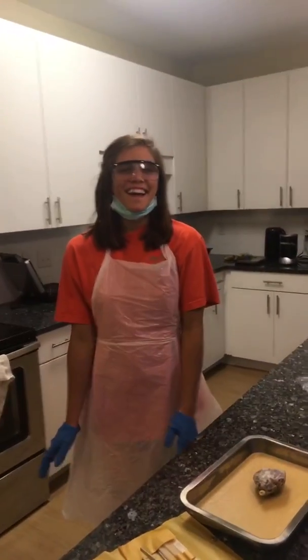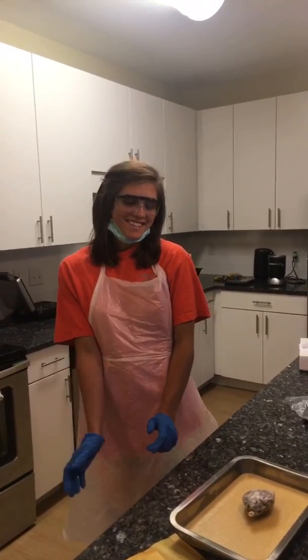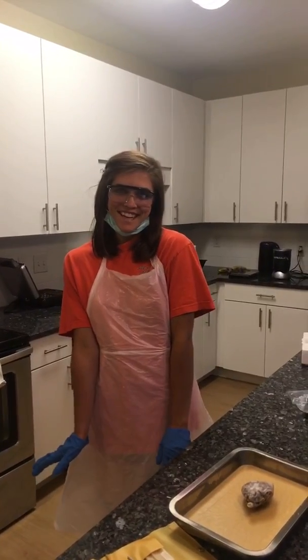Hi, I'm Mary Catherine Gardner, and this is the Sheep Brain Dissection.